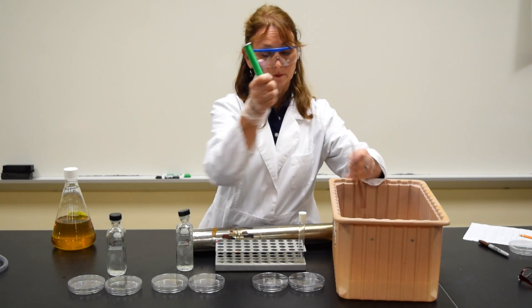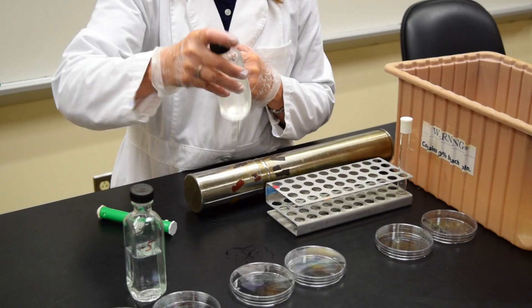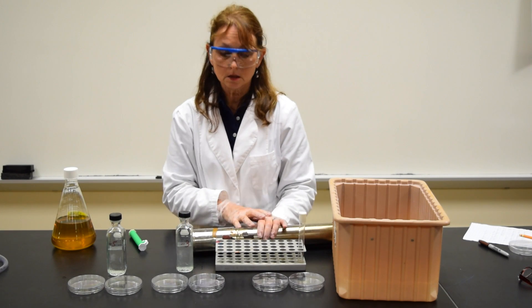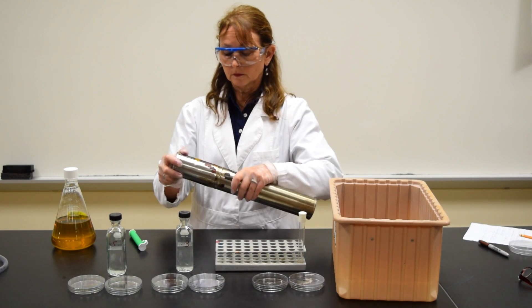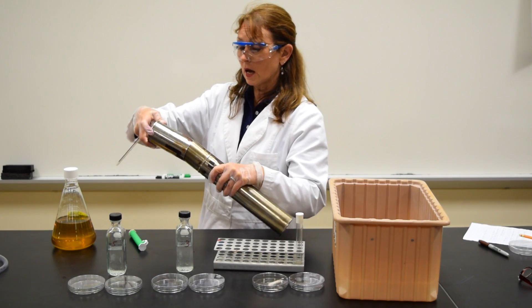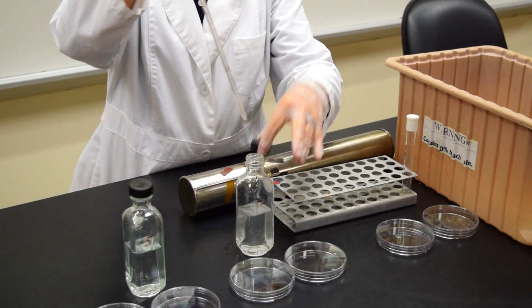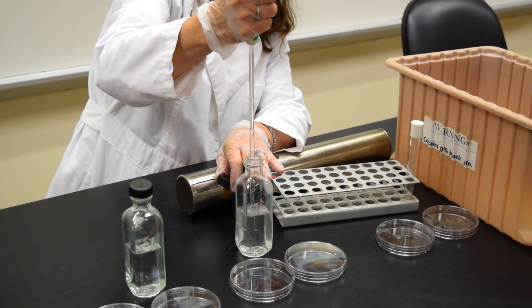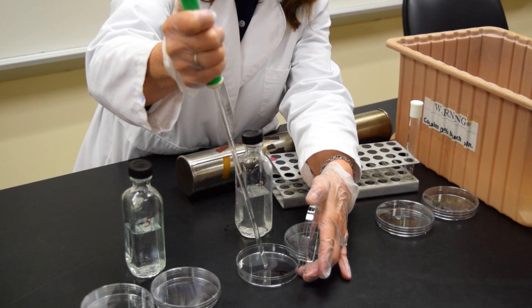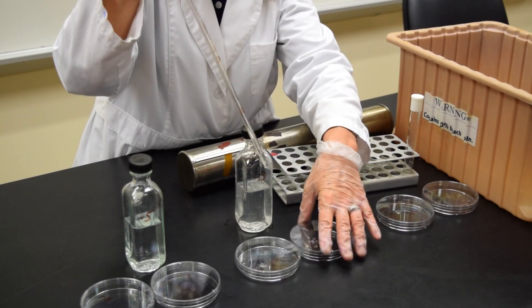Change the pipette. To mix the bottle, cap the bottle and shake it. I'm going to uncap the bottle to make it easy for me to get into the bottle while I'm holding a pipette. Open up the can, get out a new pipette. I'm going to draw to 1.1 ml, dispense 0.1 ml in the minus 4 plate, and the remaining 1 ml in the minus 3.